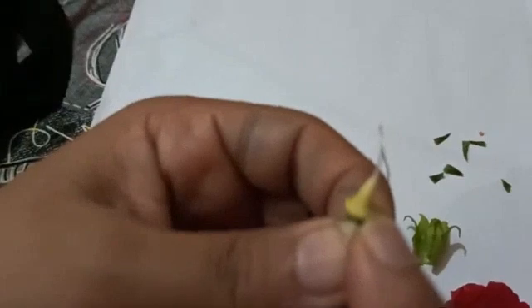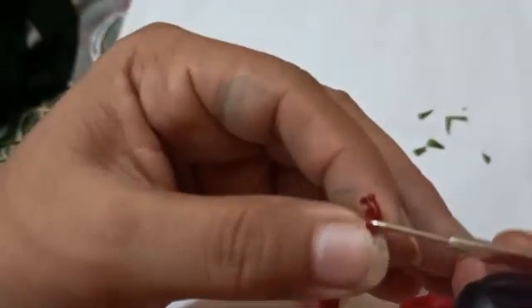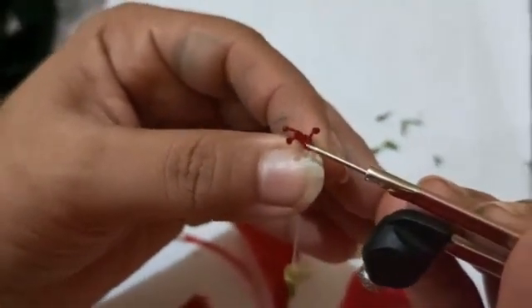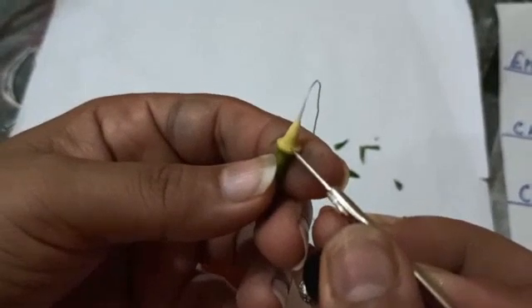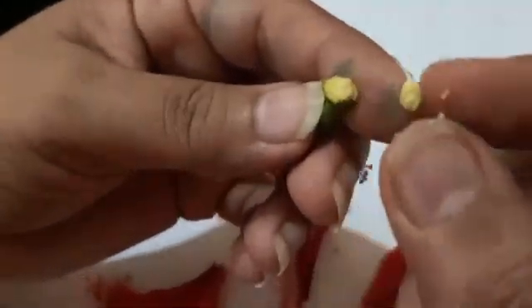Now the staminal tube is removed. This is a fine filament-like style, and the base part is termed the ovary. You can do this at home using a needle or compass tip. At the end of the style, the stigma is pentafid — meaning divided into five parts: one, two, three, four, and five. All the floral parts are attached at the thalamus, also known as the receptacle. Inside the ovary there are ovules — when you press the ovary, the ovules come out.